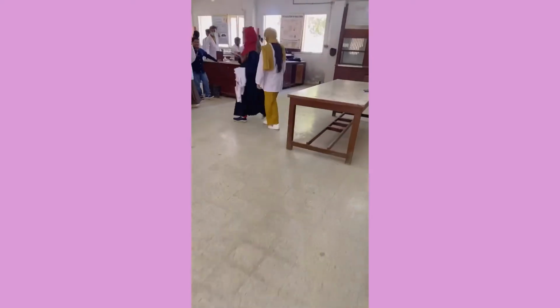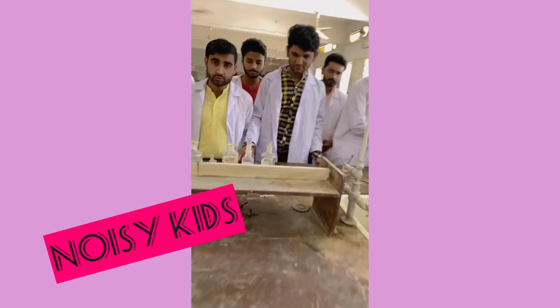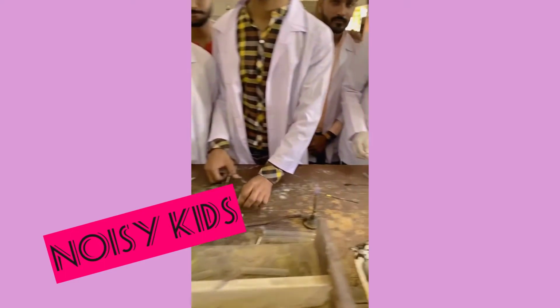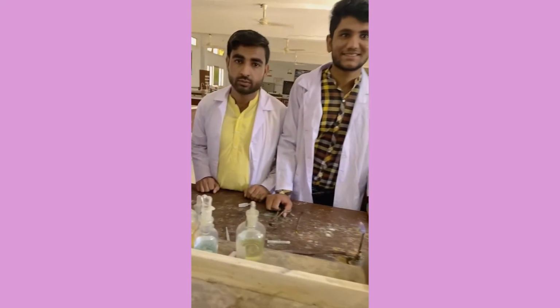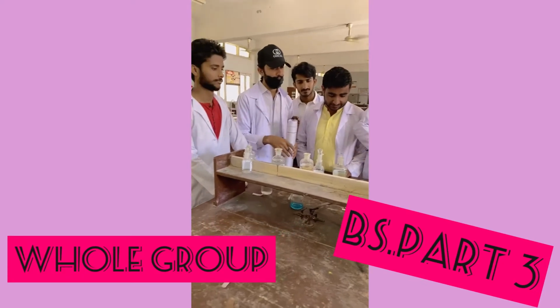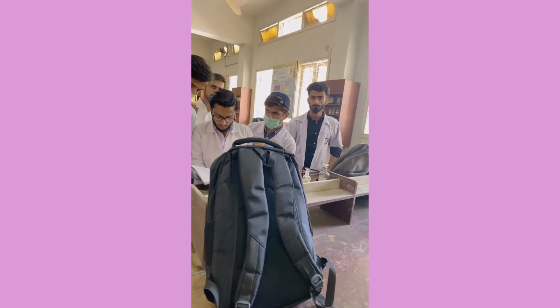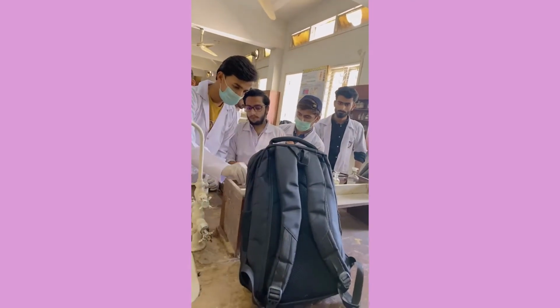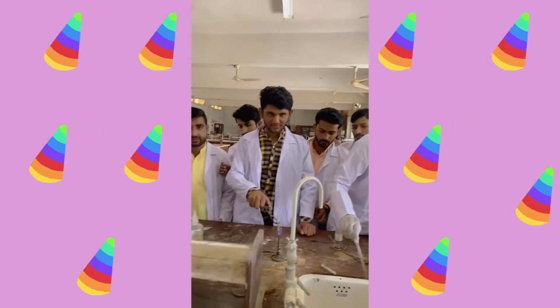Let's see. My students are working in different groups. The boys are working, almost all together, and this is the last day and the last experiment they are performing. I'm very happy that we have finished our work within the due period of time. The semester is not over, but we have finished our 8 experiments, which was a very lengthy task, but we have done it.